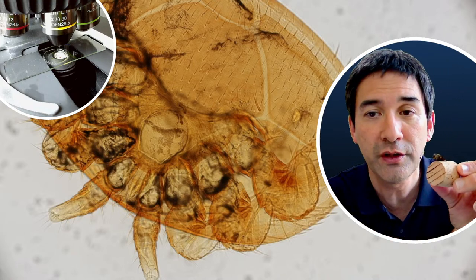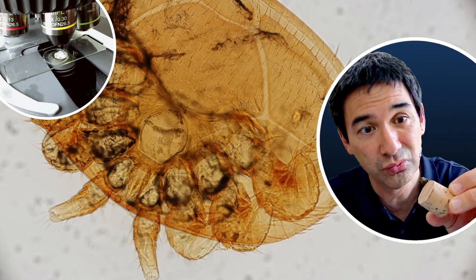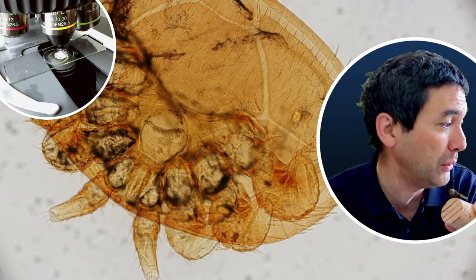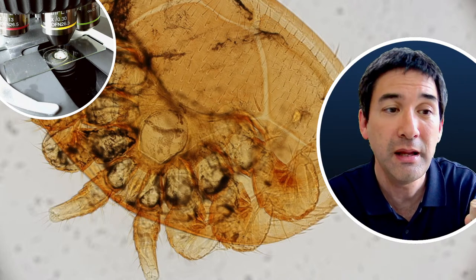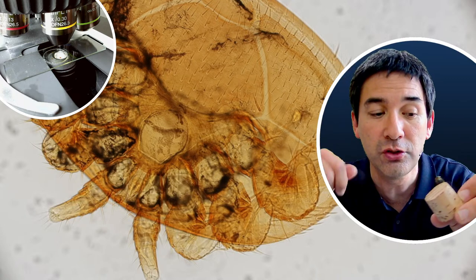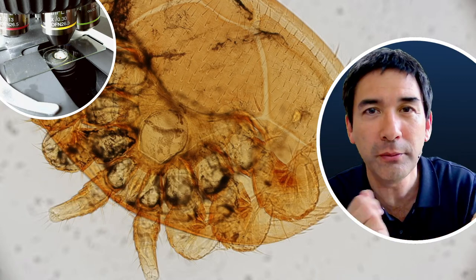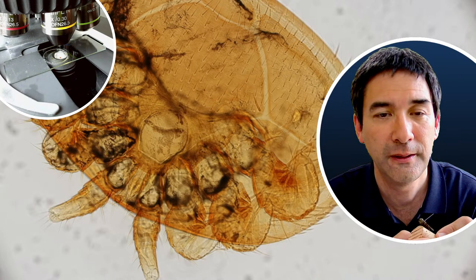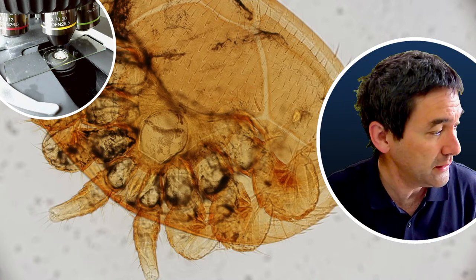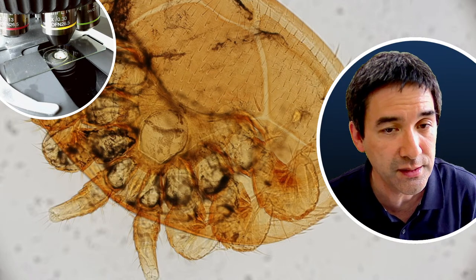The purpose of a stereo microscope and a compound microscope is very different. How I'm going to put this fly under the compound microscope — I cannot really do that very well. There is a possibility with the low-power 4x objective and using a flashlight — I've also done this before — but in reality the compound microscope is not designed to do that. So let's look at a couple of other things with the stereo microscope.